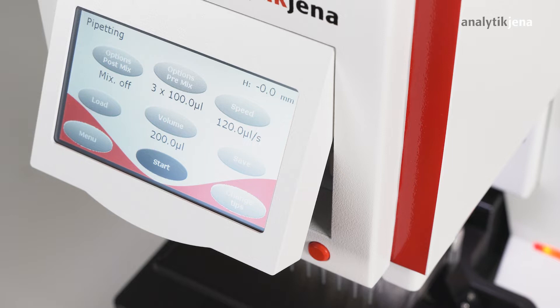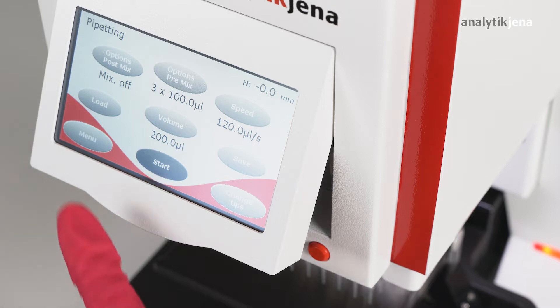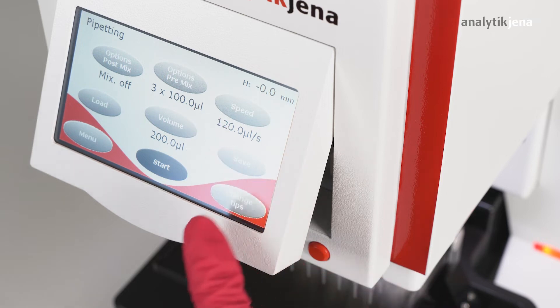The parameters can then be set through the respective buttons. In this example, the following parameters are chosen.